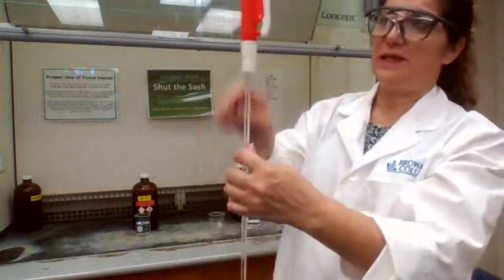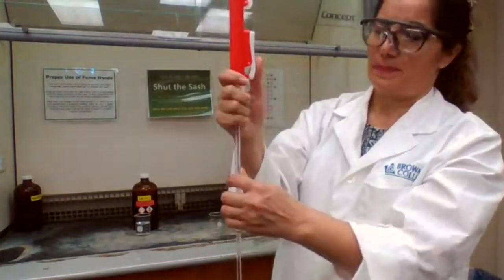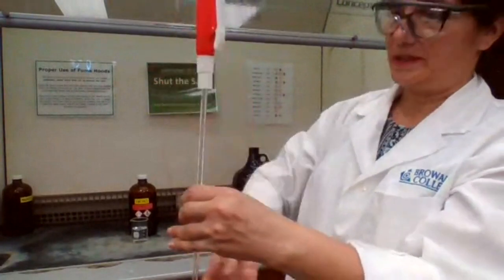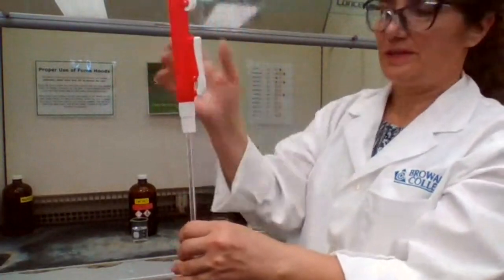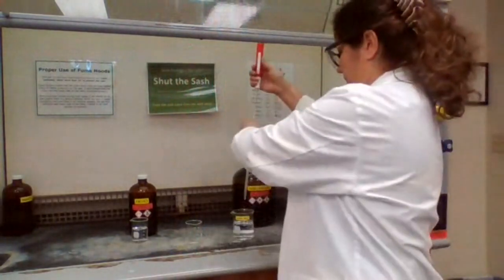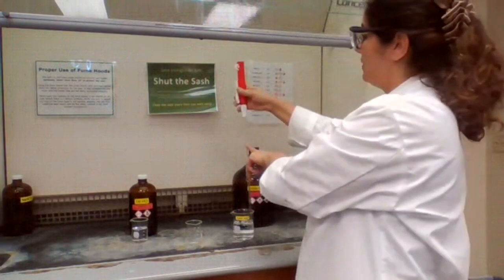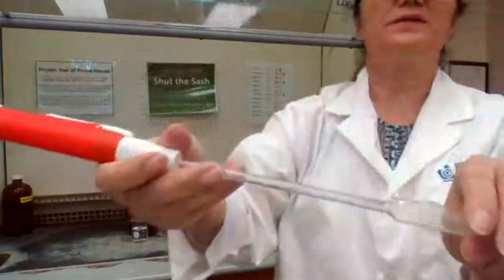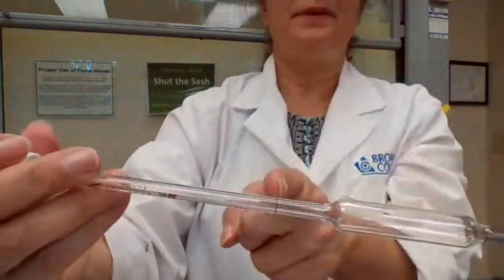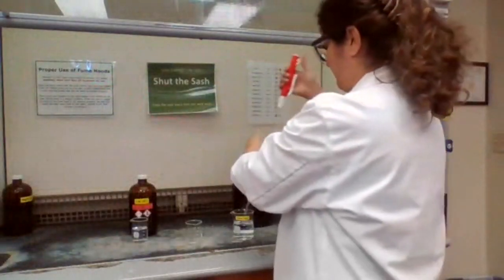To pull the liquid in, you wheel down the pipette pump. This design of the pipette pump, that's how it works. You wheel it down to pull the liquid in. To wheel up, you dispense it into the beaker. So 4 times. And each time I have to bring the solution to the mark or the index line. There is the index line here, the brown line, that if I fill up the pipette up to this point, it's going to give me exactly 10 milliliters.